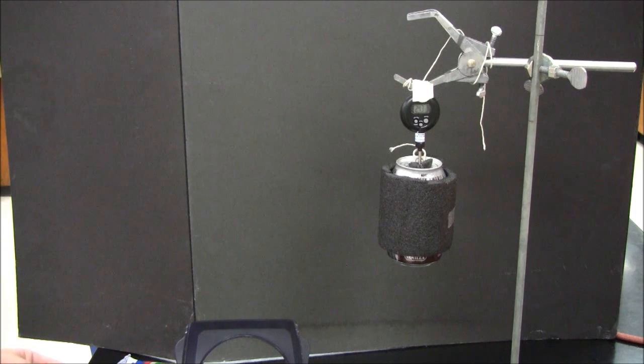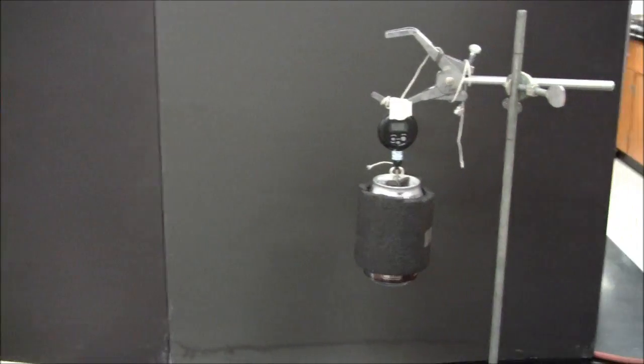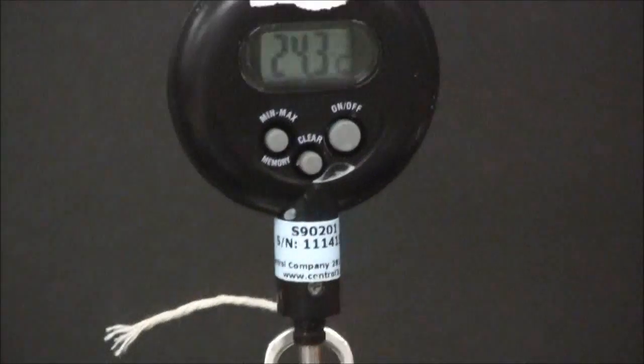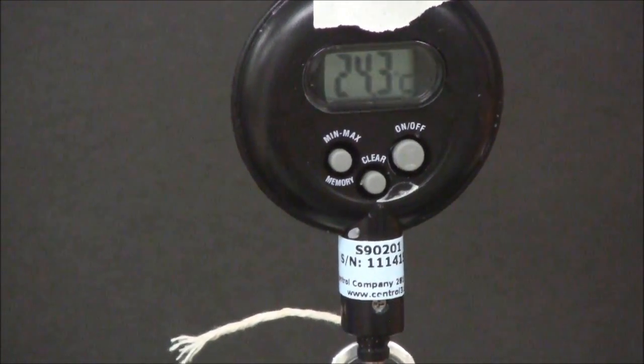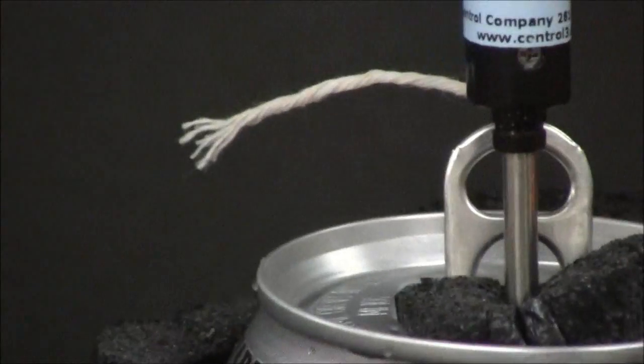All right, I just weighed the pasta. It's 1.149 grams. All righty. The temperature seems pretty stable. So on with the heating.